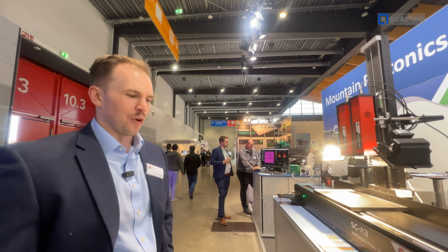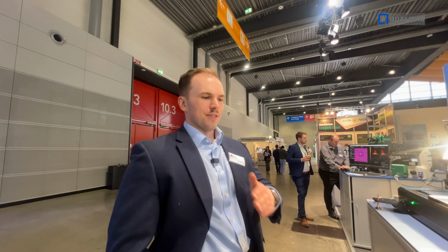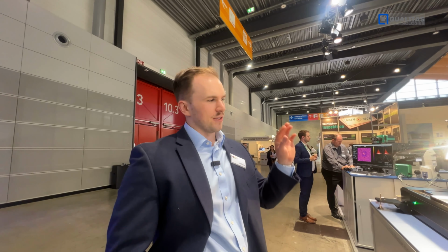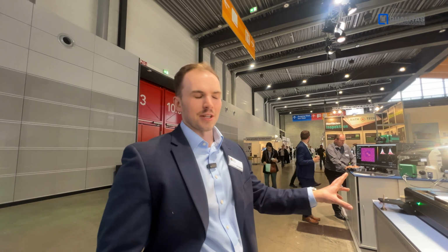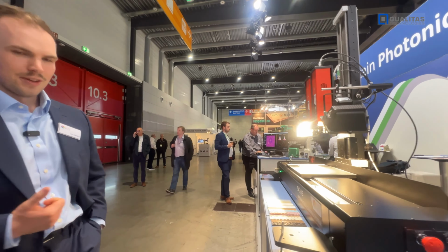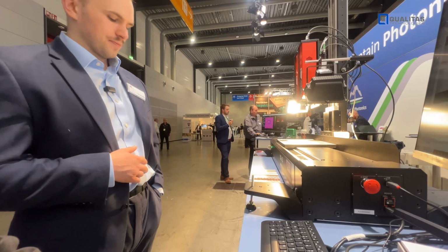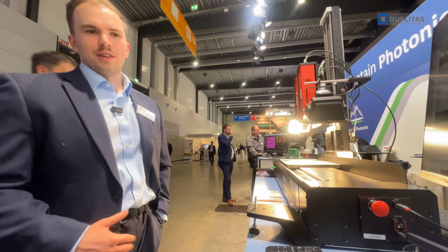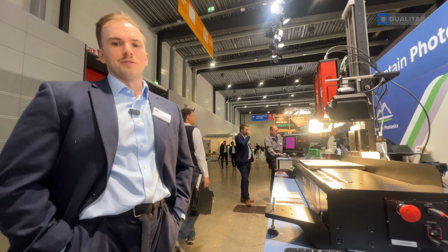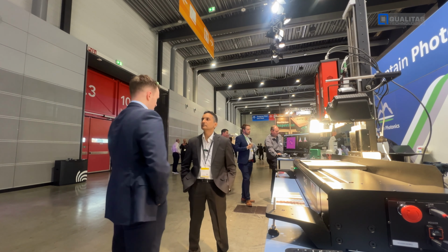So what kind of applications, in which industries? Various applications. Although our company now is focused specifically on hyperspectral imaging, in the past we've manufactured systems for light measurement and light sources, so monochromators, fluorimeters, and also tunable light sources, as well as HSI systems. They've been deployed into a range of academic and industrial applications.